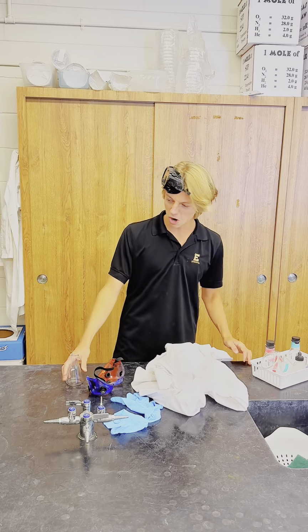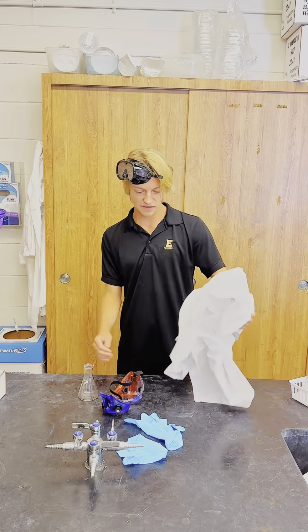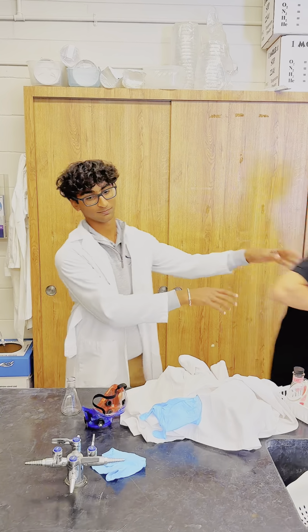Ugh. Yo, if only someone could help me. A bunch of acids and stuff. A lot of safety gear to wear, but I don't know how to put it on. I got you, buddy.